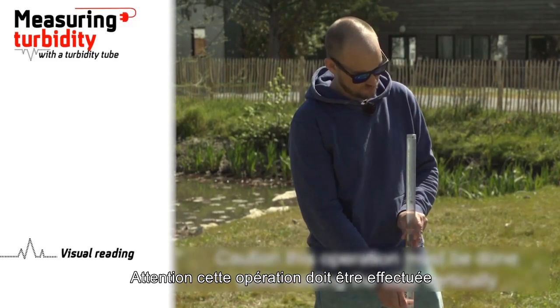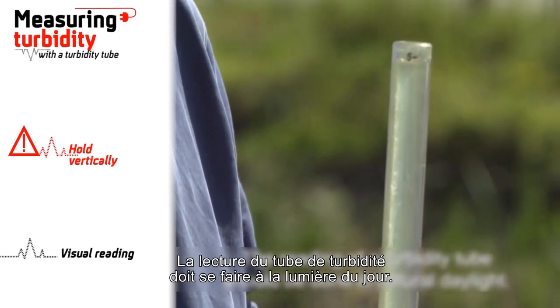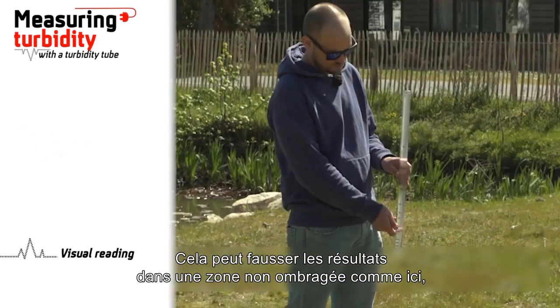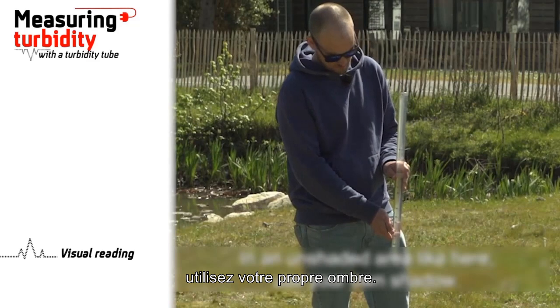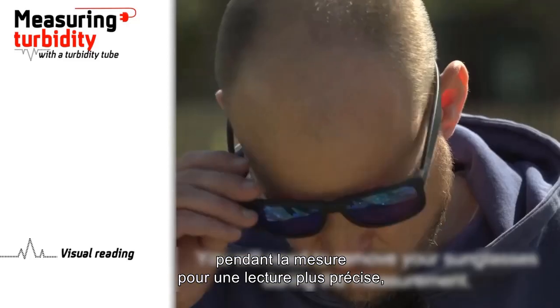Caution: this operation must be done while holding the tube vertically in good lighting conditions. The reading of the turbidity tube should be done in natural daylight. Avoid direct sunlight. This may distort the results. In an unshaded area like here, use your own shadow. You will need to remove your sunglasses during the measurement.